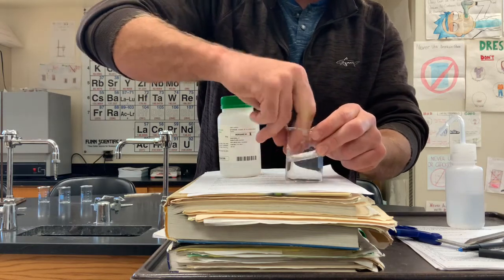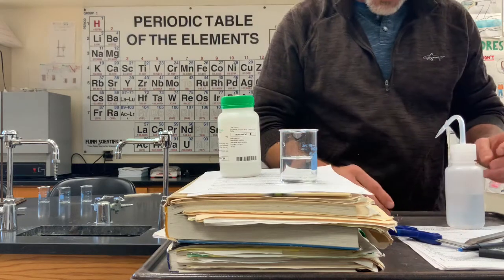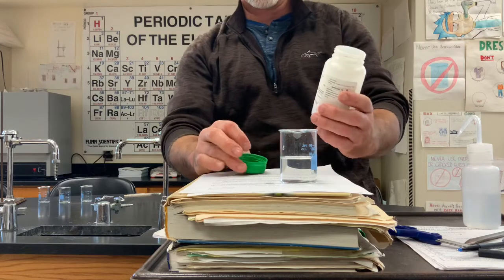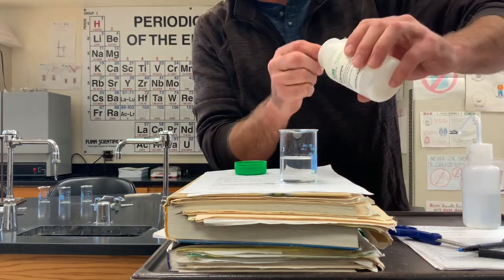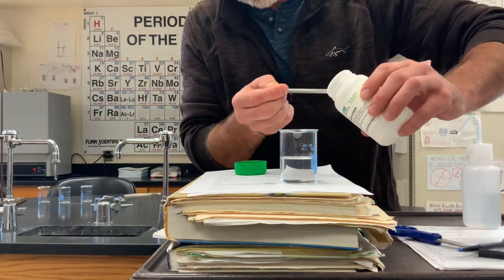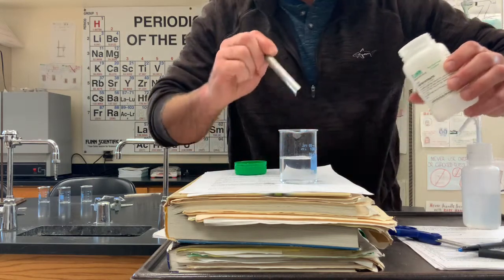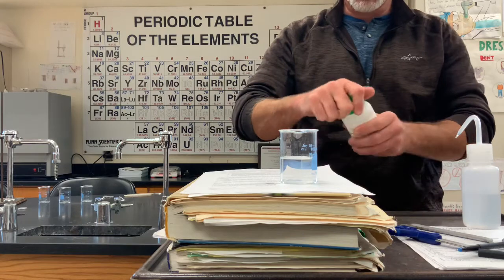So don't be silly about that. If I can get it back out, we'll show you. Wet copper. Now I'm going to take that same copper and I'm going to make a solution of silver nitrate. And we only need a couple crystals.